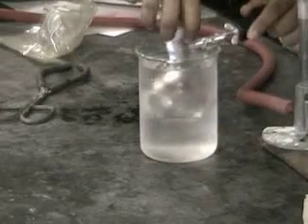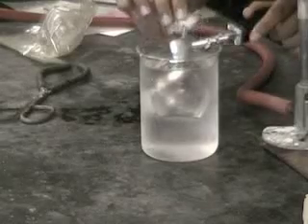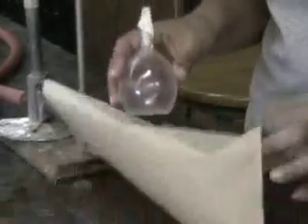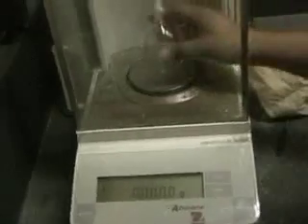After it is cool and we're convinced it's all liquid, we unseal the flask to equalize the pressure. We then reseal the flask and dry the flask completely in order to find the mass of the liquid that's in the flask. We'll find the mass of the liquid by subtracting the mass of the empty flask from the mass of the flask with the liquid. It must be completely dry because it was dry when we started.